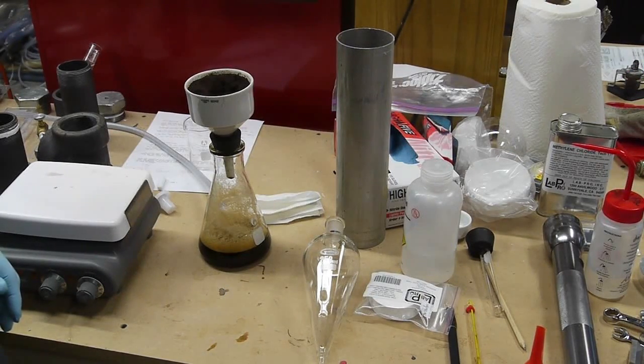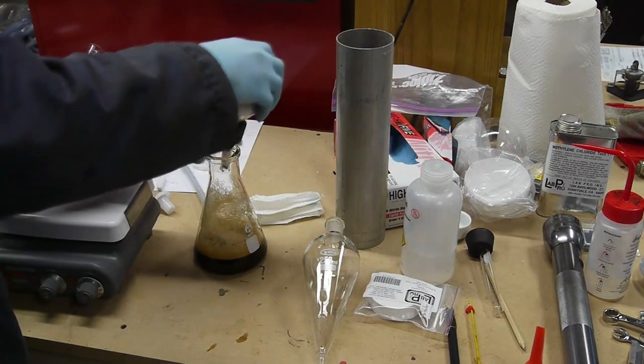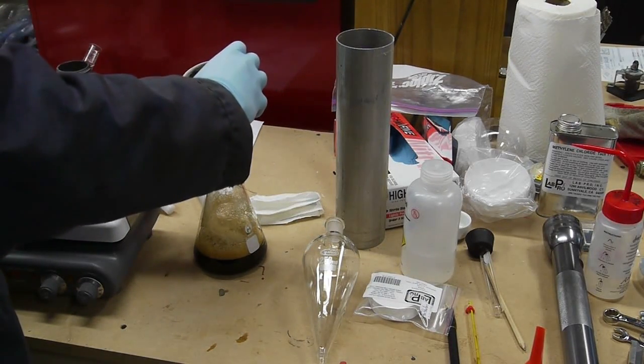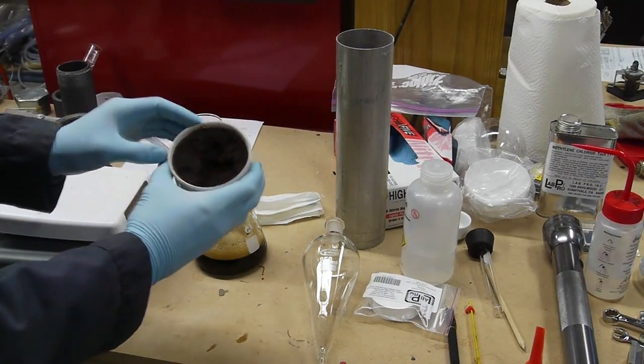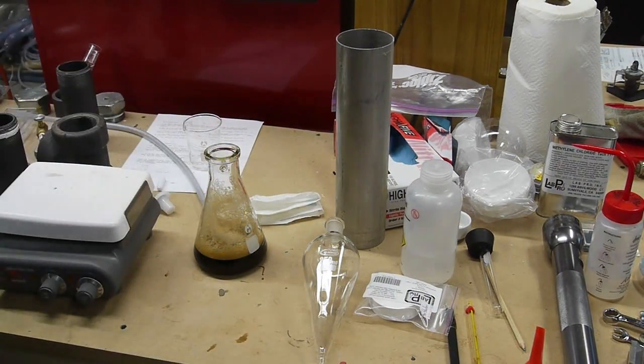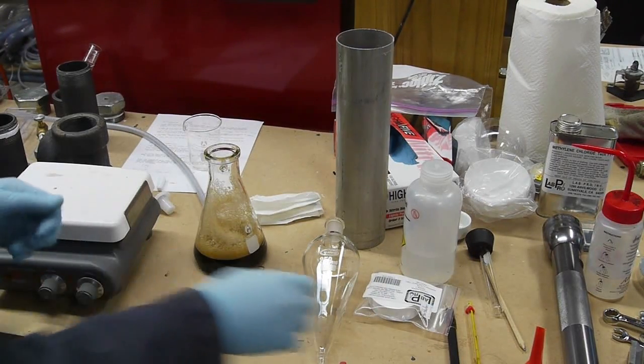So what I ended up with is 200 milliliters of a very strong coffee. I actually didn't taste this unfortunately - I didn't even think of it, I was kind of distracted with other stuff - but I'm sure that would be even stronger than espresso coffee: 50 grams of coffee into just 200 mils of water.